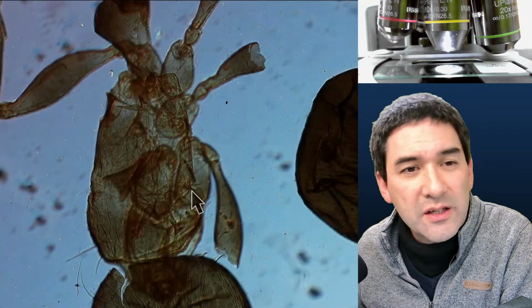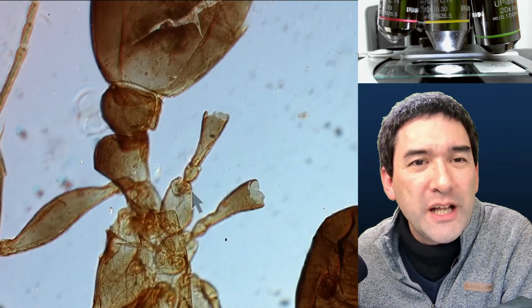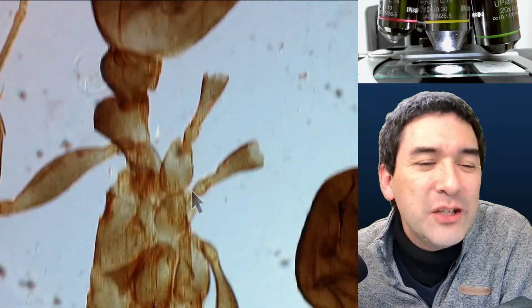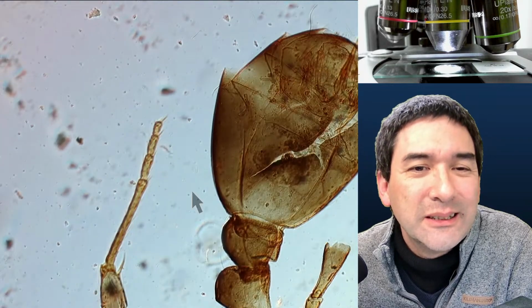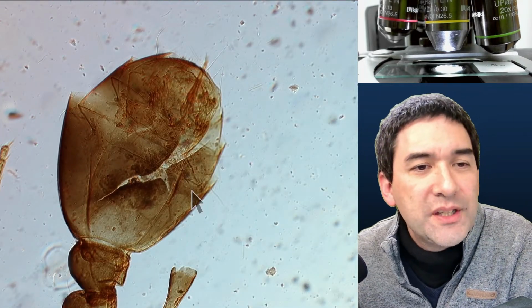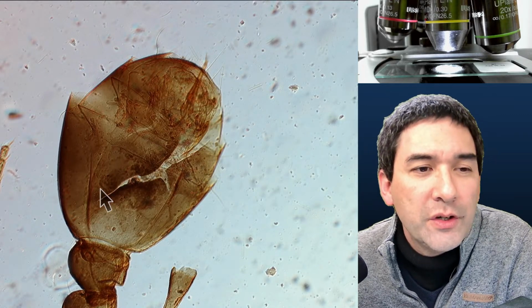So that is basically the ant, and as we can see here, maybe not such a nicely prepared specimen. Look at the legs. I think still interesting to look at, right? Over here, this might also be an interesting thing. You can see that actually the abdomen, which is fairly large, over here is ripped open.